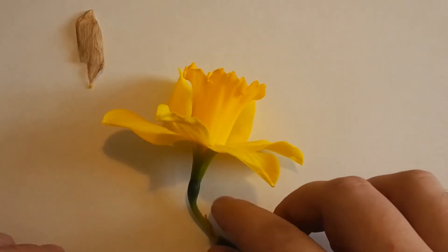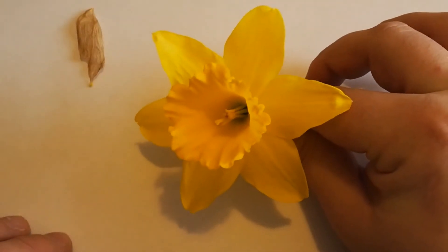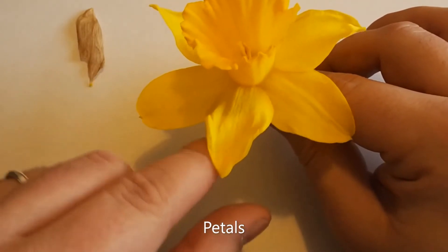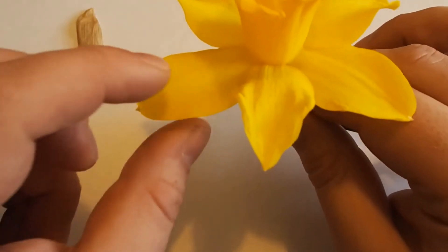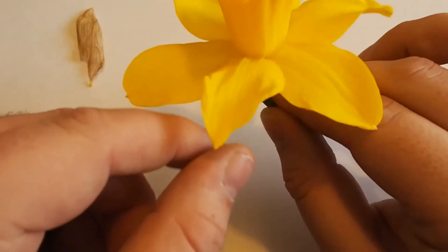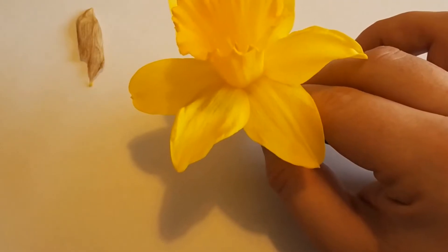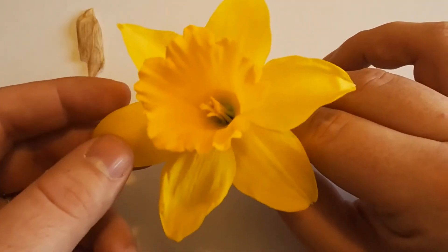Let's now look at the flower properly. We can have a look right in the front here, and you can see that there are six petals. In fact, if you look closely, you can see that three are on the inside and three are on the outside — a total of six petals. Now what we're going to do is remove these petals so we can have a better look at the rest of the flower.